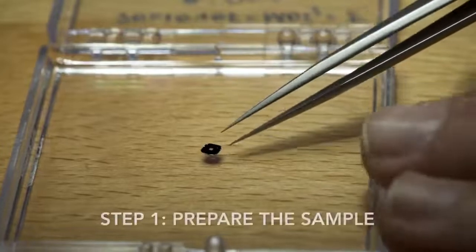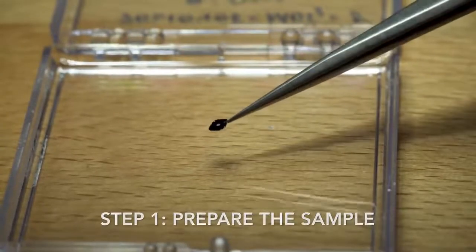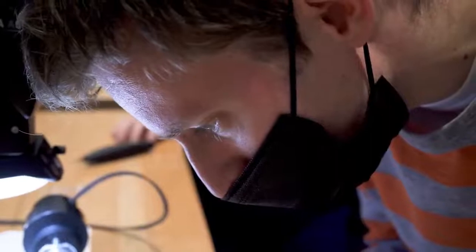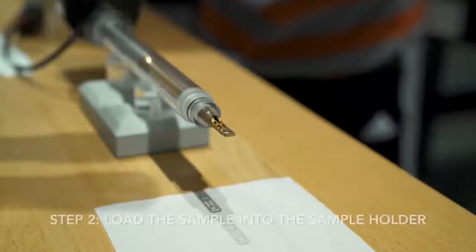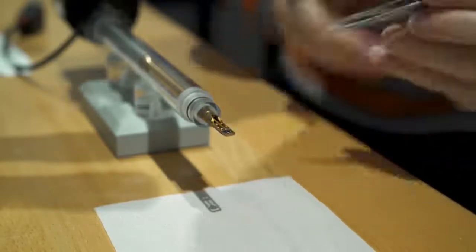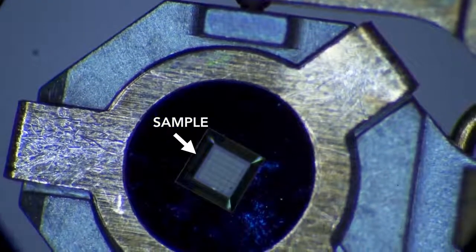Here's how it works. In order to achieve an atomic resolution, the sample used must be extremely thin, 1/1,000,000th of a millimeter, or 1/100,000th of a strand of hair. The sample must be this thin so that electrons can travel through and interact with the material. Once the sample is placed into the holder, it must be inspected to make sure the sample is loaded securely and there is no contamination that could degrade the microscope vacuum.